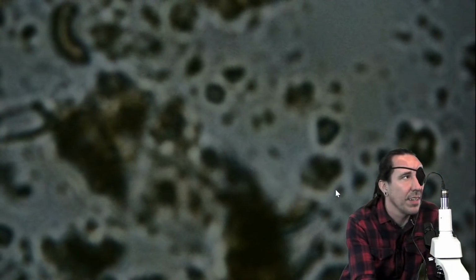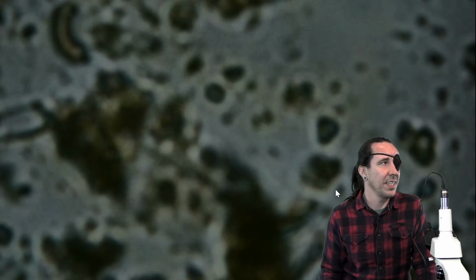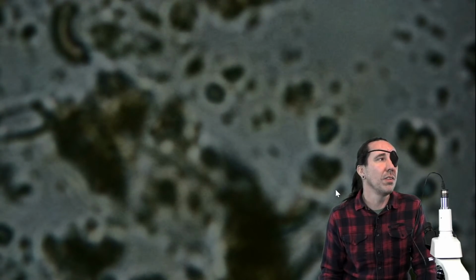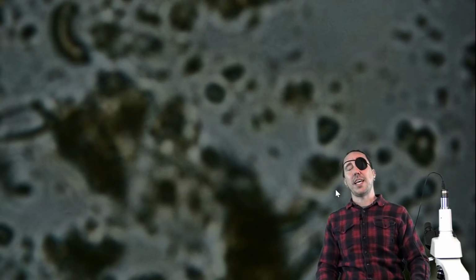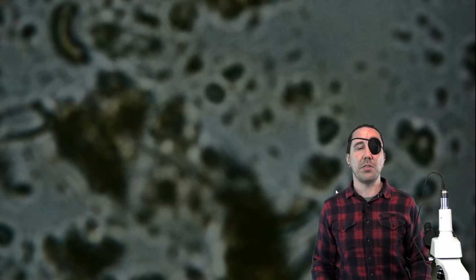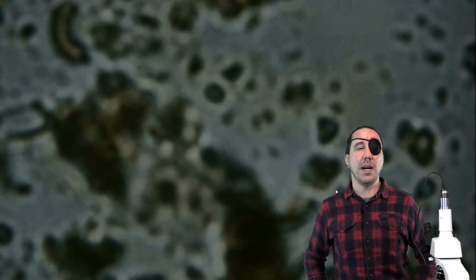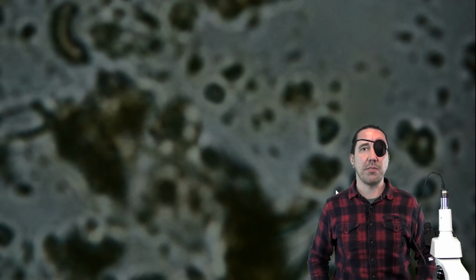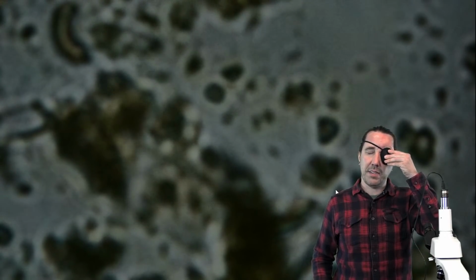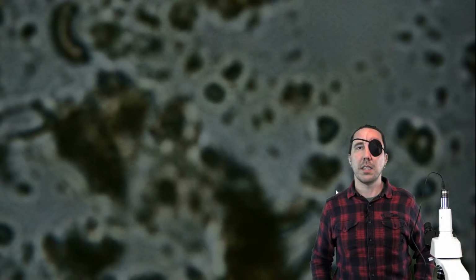Did you see anything there? Well, two things I wanted to say. I've got video of nematodes swirling around from prior samples. So Dan had just mentioned that he's got some videos of nematodes swimming on his computer that we can bring up and show you all the movement of the nematodes, just to have some view of nematodes. Can you switch me off while I go look for it? It might take me a second.